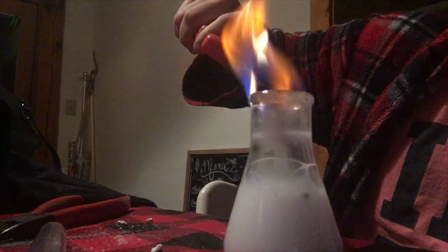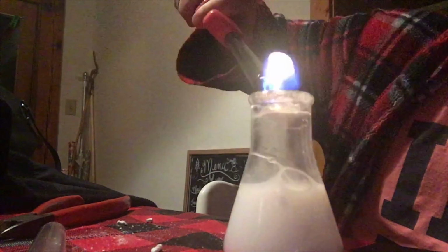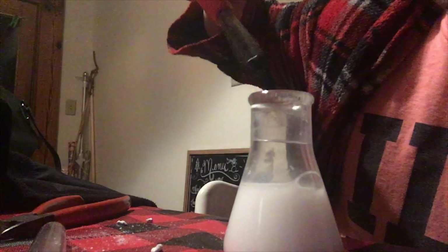If you notice, see? Is it still going? There we go. Now I'm going to add in these last few pieces of calcium.